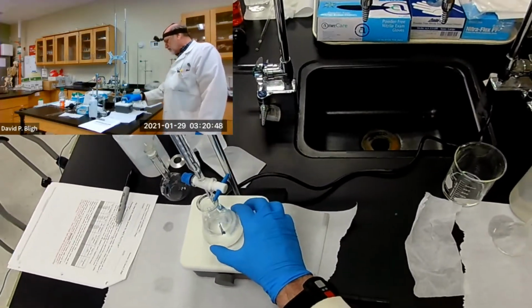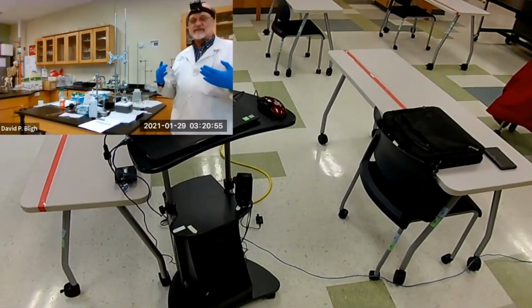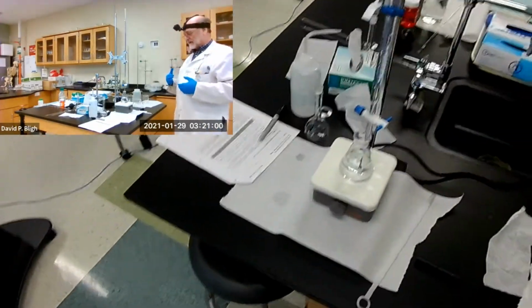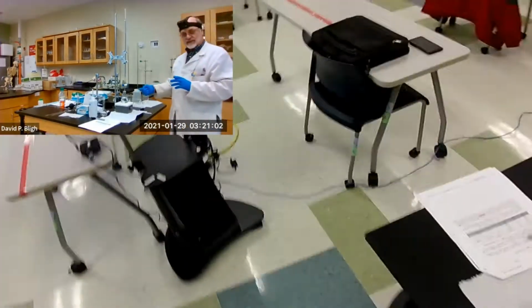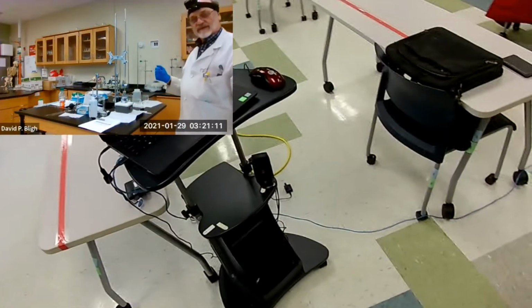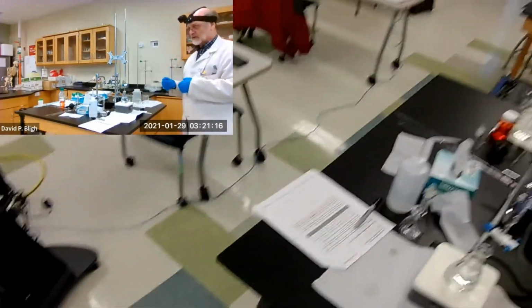Now what I have to do, since it's set on 0, is I have to dim the lights. So I'm going to dim the lights and see what effect that has on the recording. Unfortunately, it might not. You will definitely be able to see the light beam, right? And I think I'll turn it this way. I know that's a long way from that camera, but maybe with my head cam, you can see the light beam as we approach the end point. Okay, so now I'm going to dim the lights.